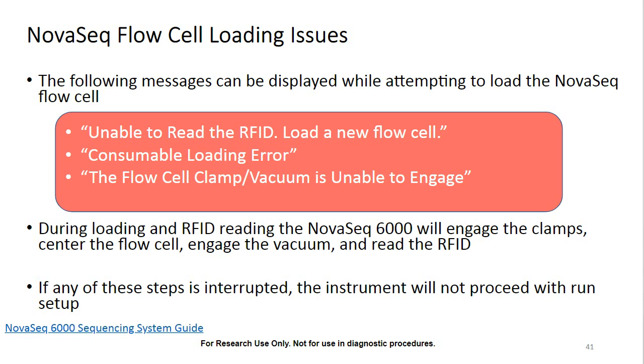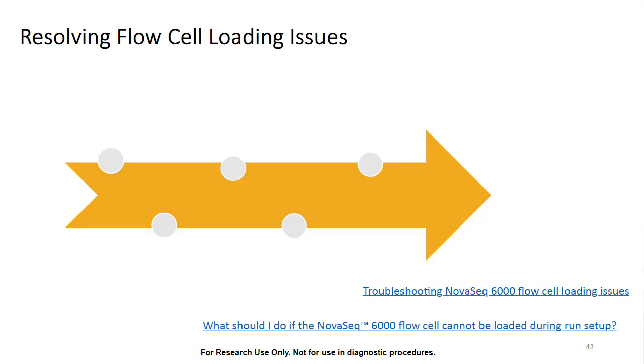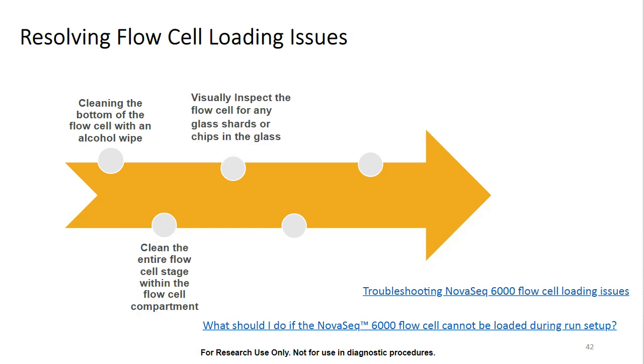So here's what we want to do. First, we can take these 3 steps. Start by cleaning the bottom of the flow cell with an alcohol wipe. From there, we can clean the entire flow cell stage within the flow cell compartment with an alcohol wipe, and then wipe each of these down with a lint-free wipe to remove any residual alcohol. Finally, we'll also want to visually inspect the bottom of the flow cell for any glass shards or chips in the glass that might be preventing getting that good vacuum seal.